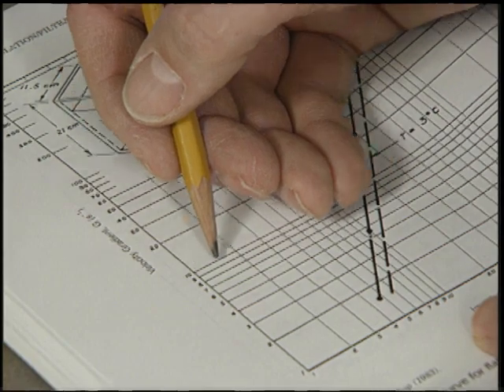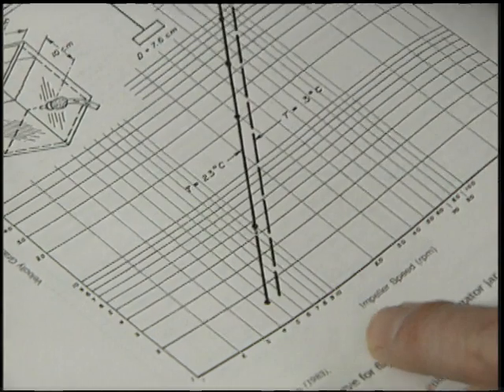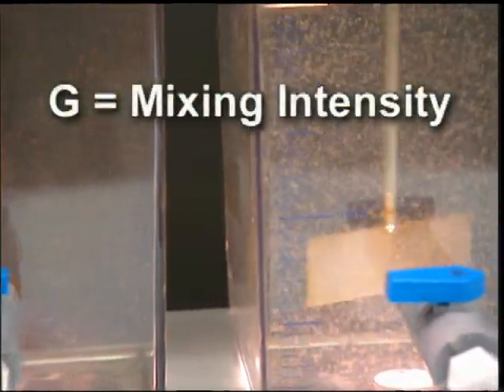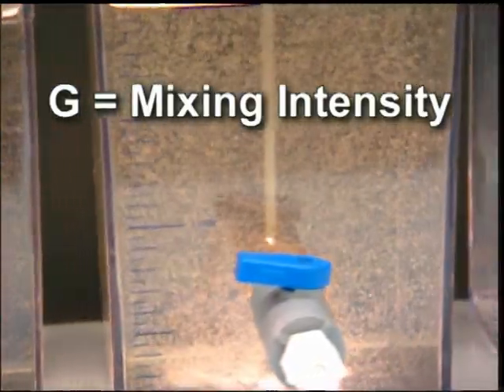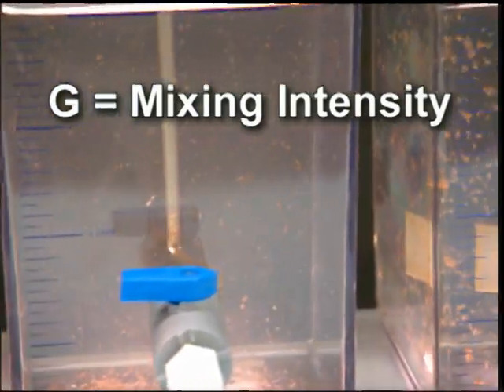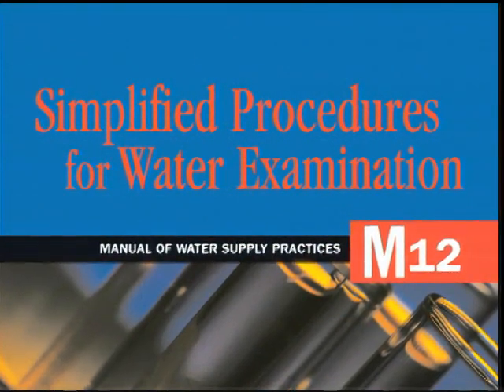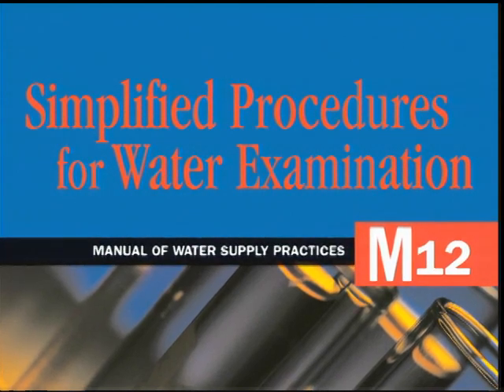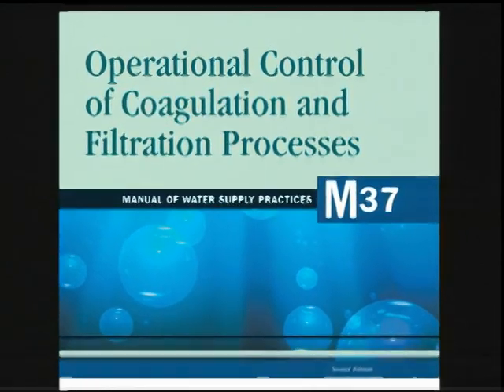The rotation speed in the jar test is correlated with what's used in design practice as mean velocity gradient, or G value. G is an engineering term that describes the mixing intensity. The full-scale plant values are usually listed in the design specifications or plant operations manuals, and the jar mixing speed or G value can be adjusted to match this value. Additional information on correlation of velocity gradient can be found in AWWA Manual M12 Simplified Procedures for Water Examination and AWWA Manual M37 Operational Control of Coagulation and Filtration Processes.